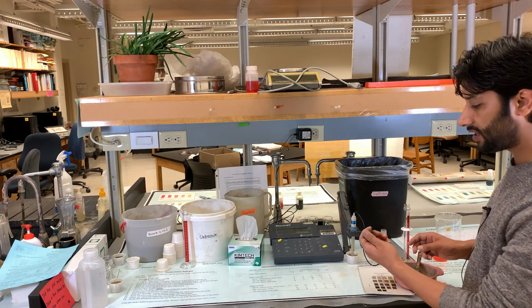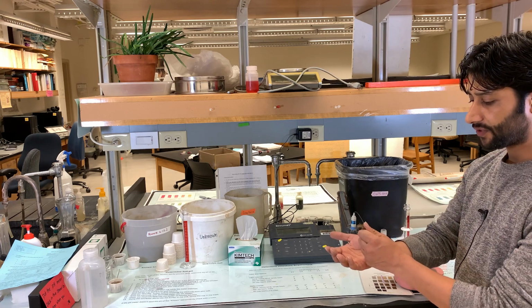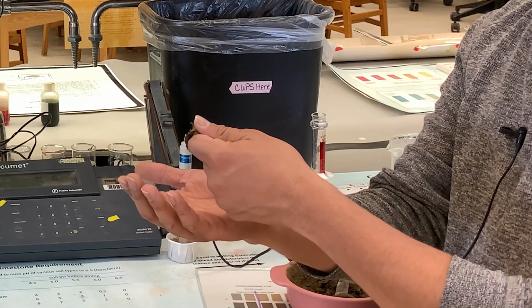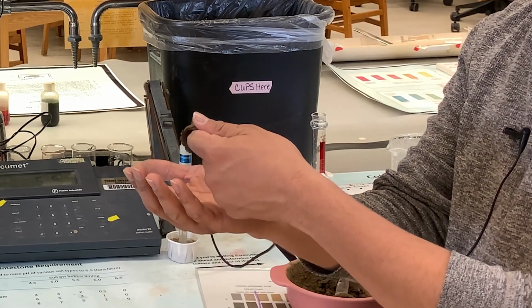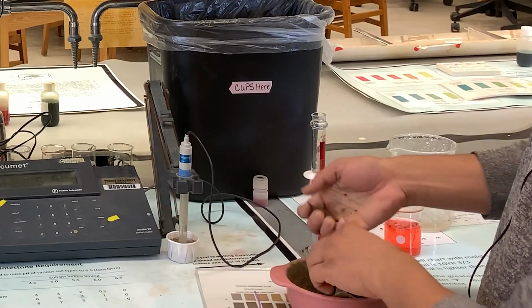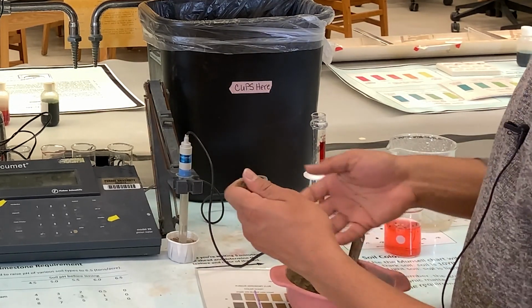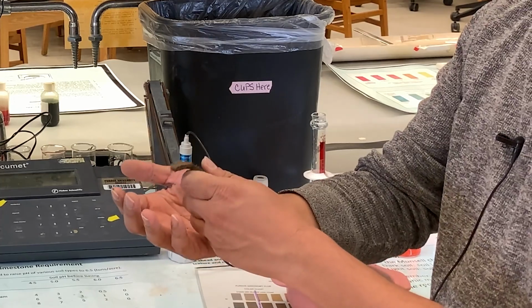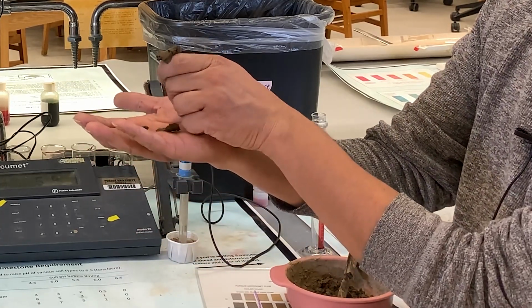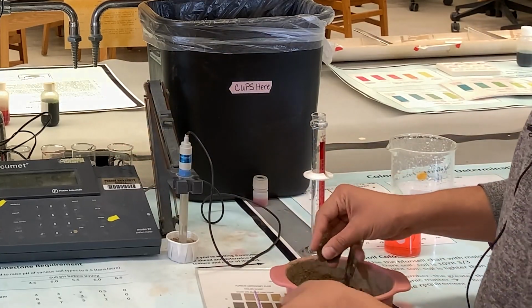So first thing that you need, beside the pH, is the texture. Based on the texture, it's very soft and smooth. So I'm on the silt side, and it doesn't make a long ribbon. It's just very soft. It's more like silt loam soil, and the ribbons are not sticky, and the ribbons are not long. You can see that the natural breaks are less than 1 inch. So that tells me that the soil is a silt loam soil.